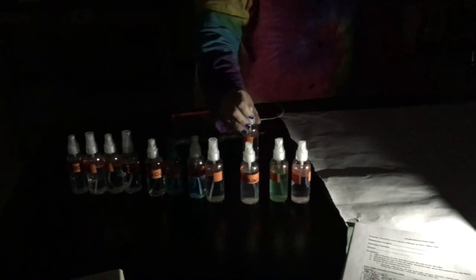Okay, so you're gonna write down the colors that you saw in your data table, and then you're gonna see if you notice a pattern between the formula and the flame color. Okay, so we're gonna pause it right now, and then we're gonna come back with a mystery solution to end with. But for right now, as Miss Thorburn just mentioned, write down all the colors you see and look for any patterns. Like, do you notice any patterns with the potassiums or with the suffix, like maybe the chlorides? Take a look at any patterns, see if you notice anything with the colors.